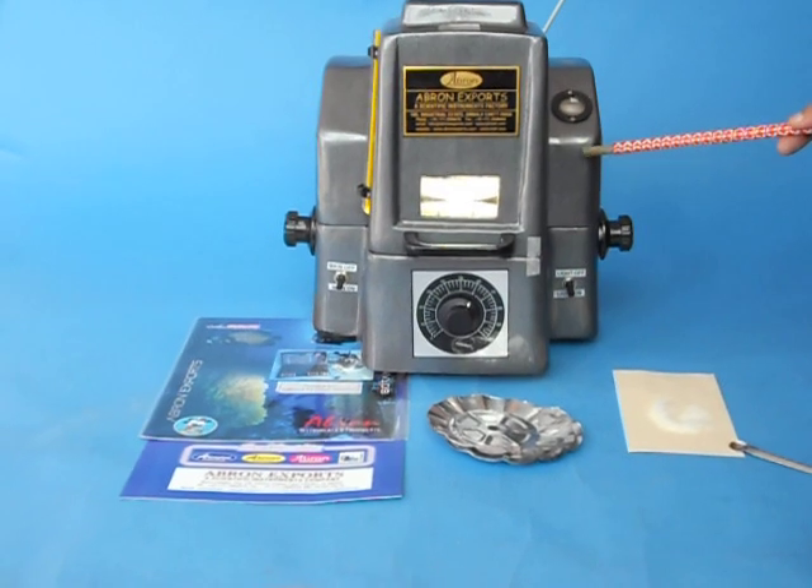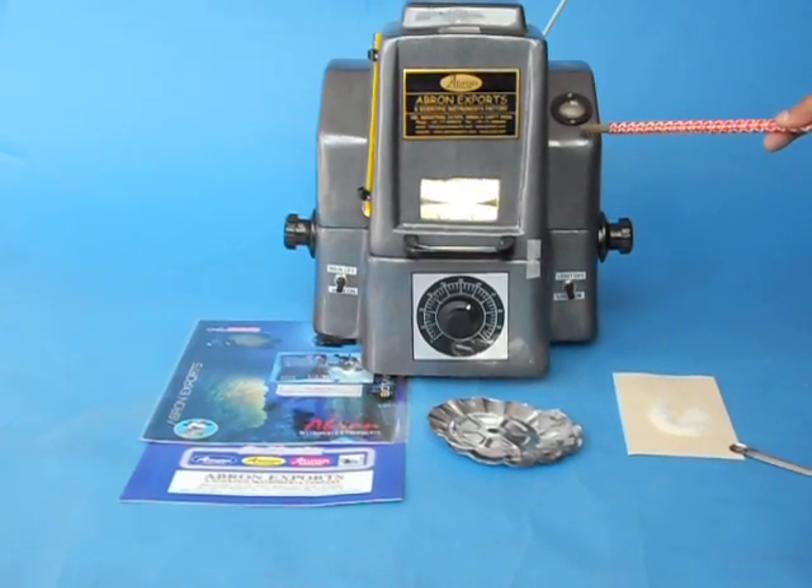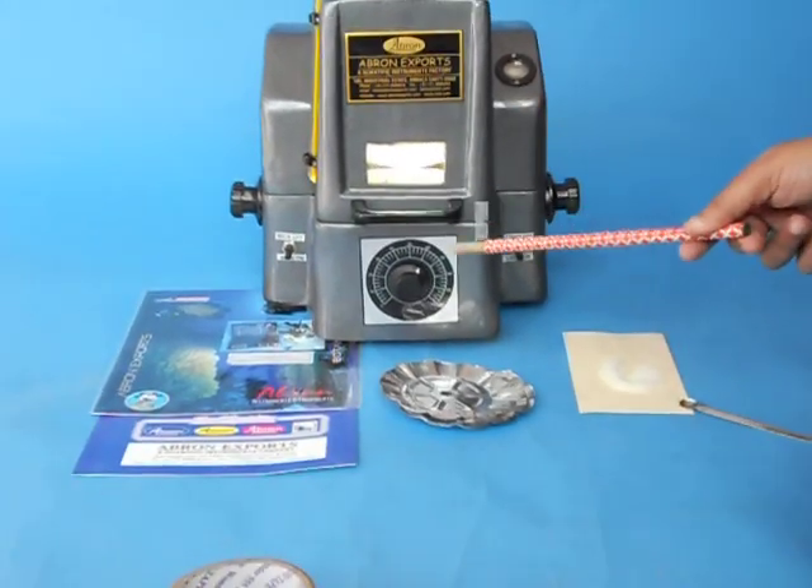A percentage of moisture can be read. This light on-off switch is for indication reading; this is for the main working of the whole system.